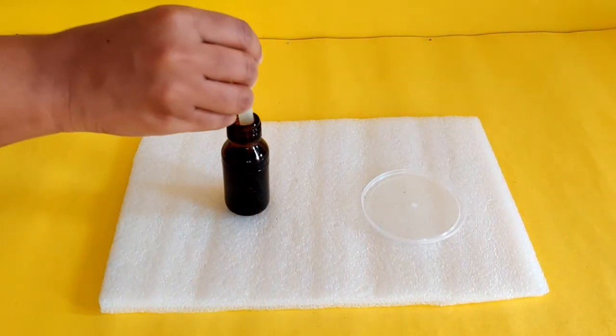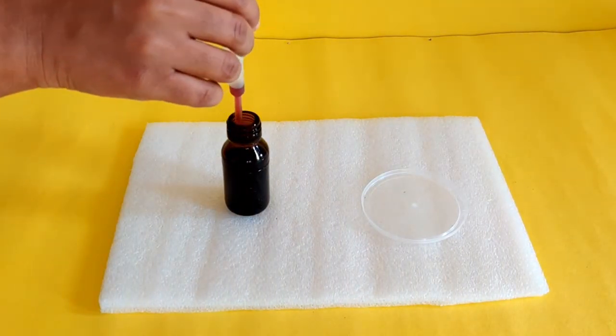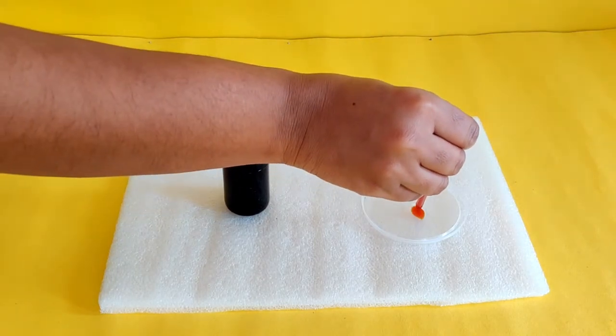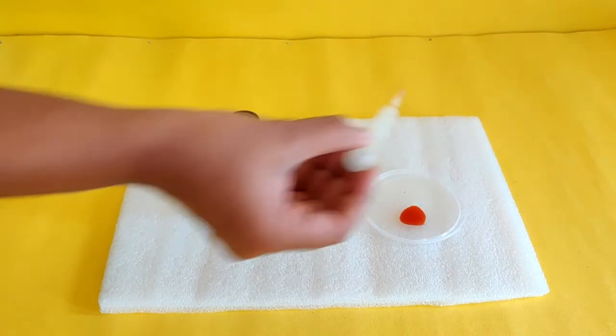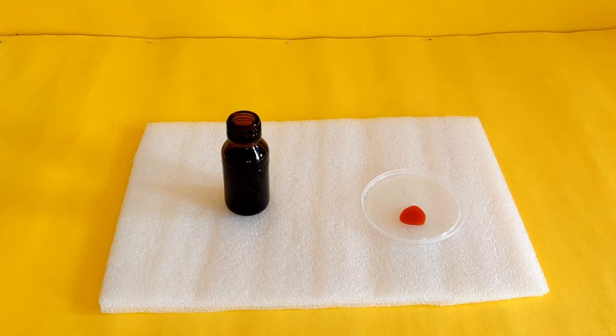Before we test the food items for starch, let us first look at the color of iodine. Iodine is brown in color.